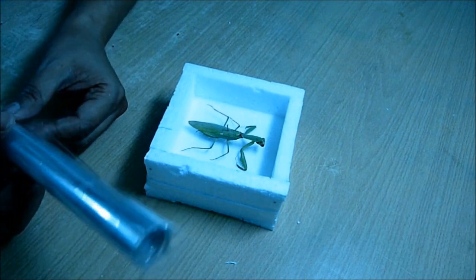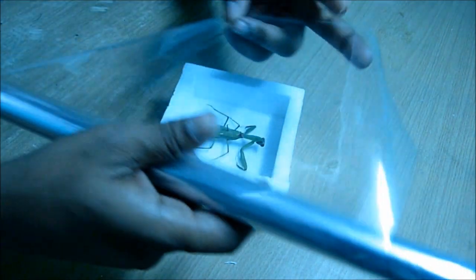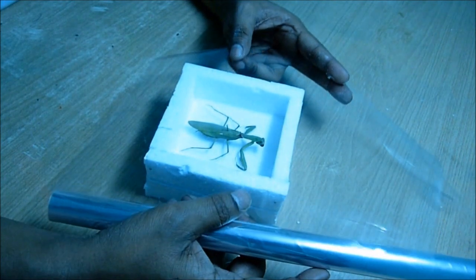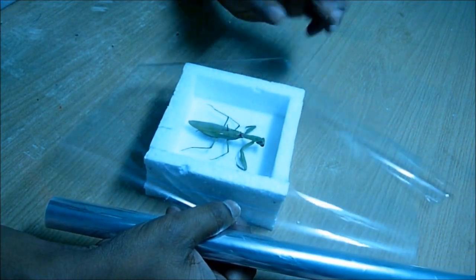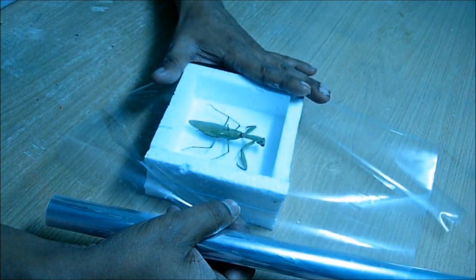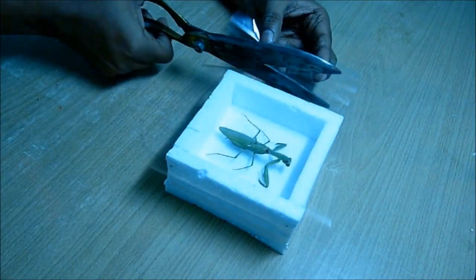To cover it on the top I have used a thin plastic paper, a transparent plastic paper. I cut it into a small size and glued it on top of it.